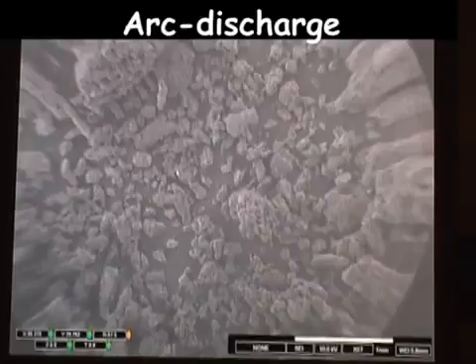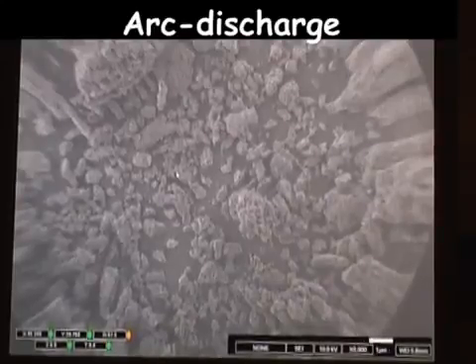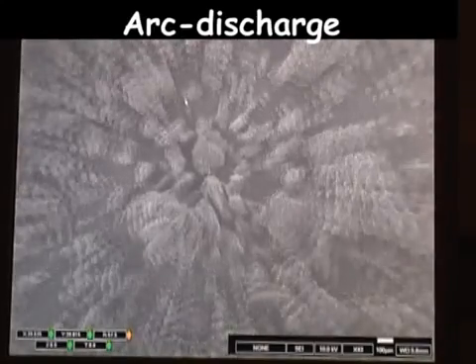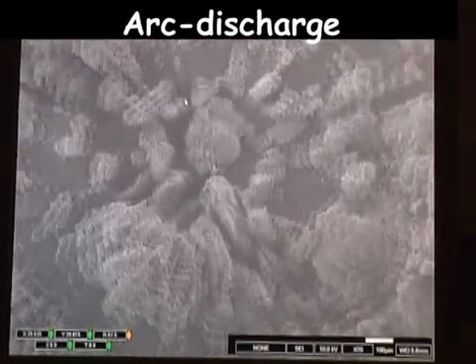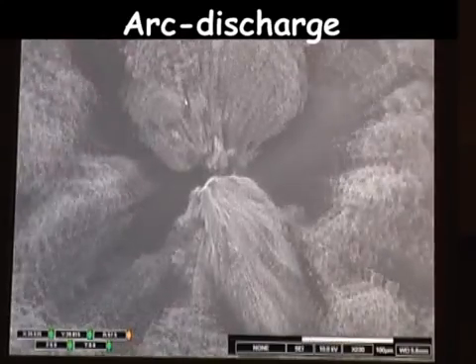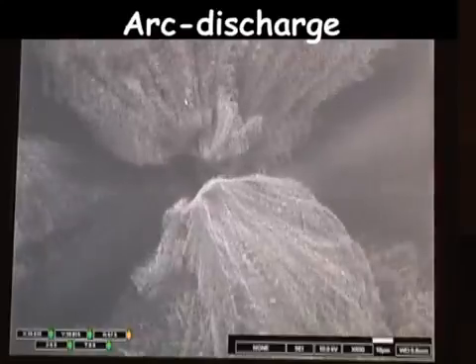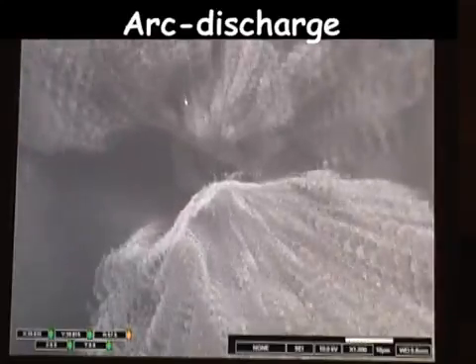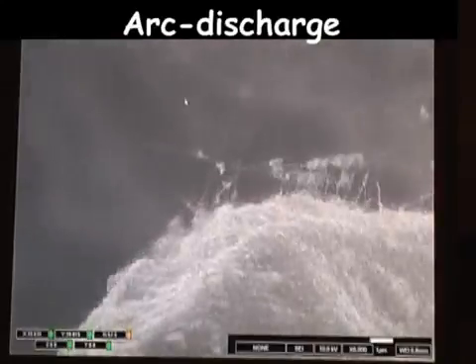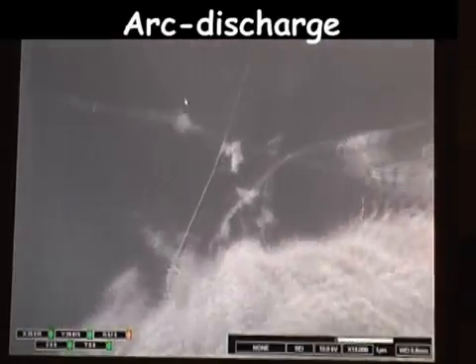At low magnification we can see already that with arc discharge we have produced other forms as well as nanotubes. But let's zoom in to find individual tubes. And there they are.